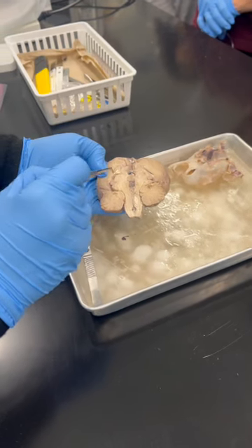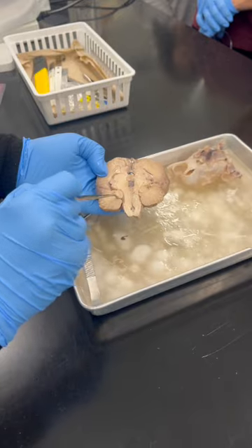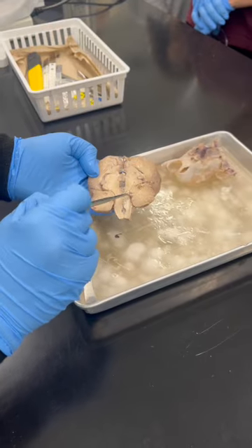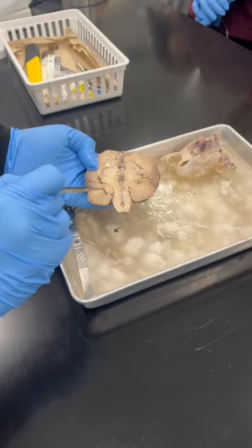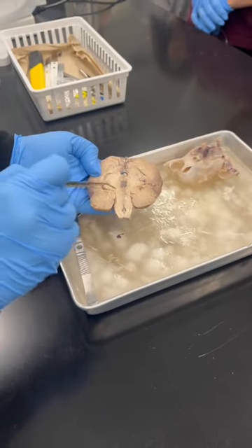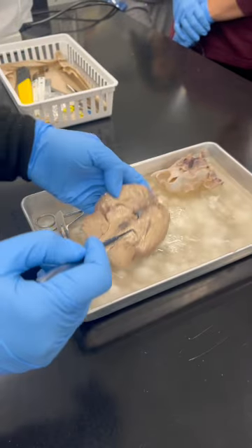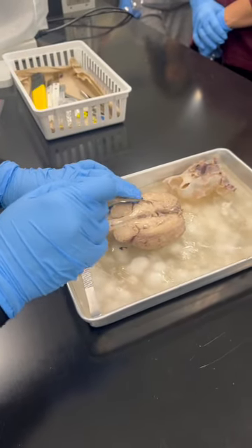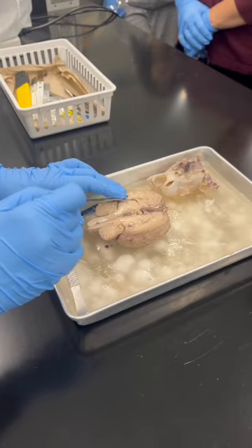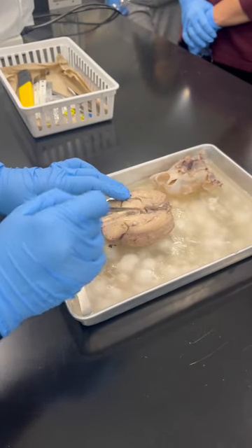So the lateral ventricle, third ventricle, then going through the aqueduct to the fourth ventricle. The fourth ventricle is over here. So it will travel through that, and then you can go to the central canal of the spinal cord. So what is produced inside this area? Cerebrospinal fluid, produced in these ventricles.